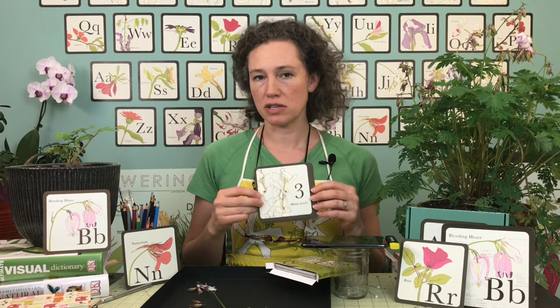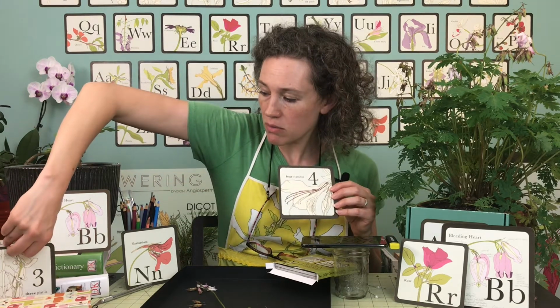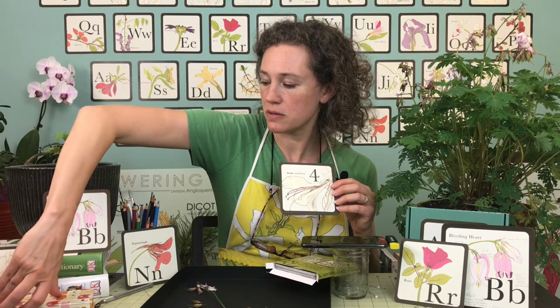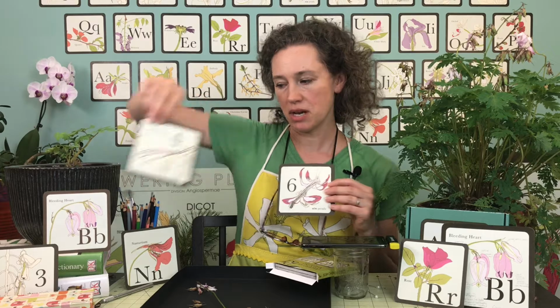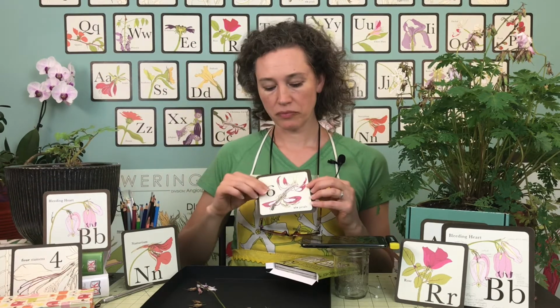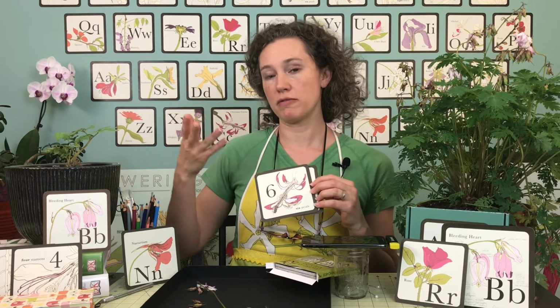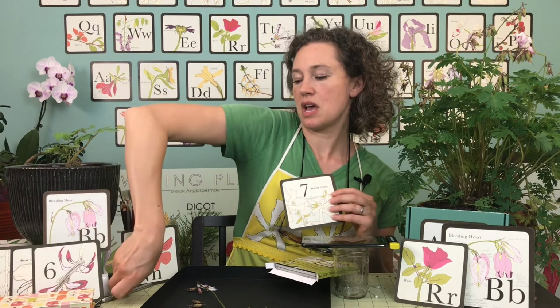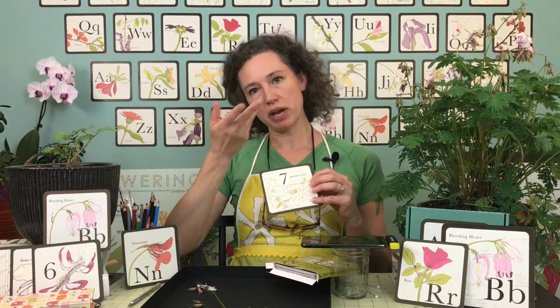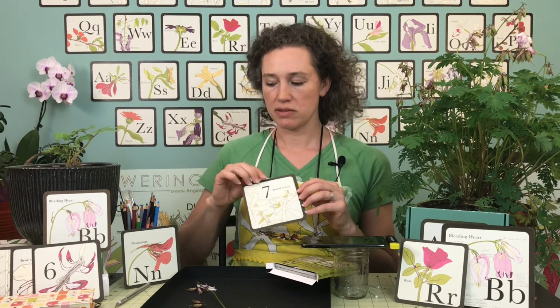So at the very center of a flower is the pistil. That will be there first. And then surrounding the pistil are the stamens, or the stamina. And around the stamina are the petals. When you have all of the petals on one flower, that's called the corolla. And then around all the petals are the sepals. All the sepals together are called the calyx.